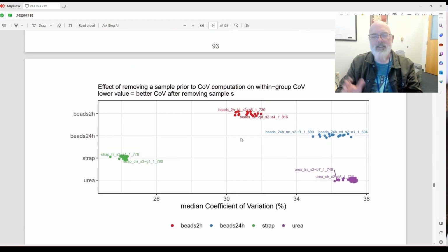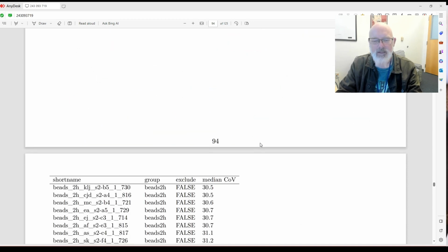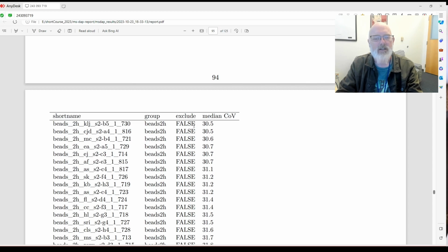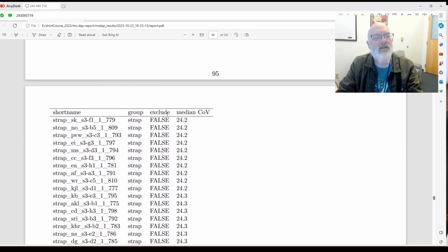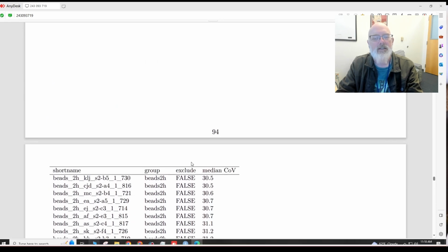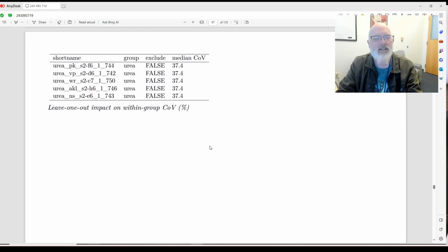And remember, when you're doing quantitation, it's not only the number of peptides or proteins you're identifying, but it's the coefficient of variation, or your ability to quantify things reproducibly. Okay. Oh, here it is. Okay, excludes. So here we go. False, false, false, false, false, false, false. Is there a true? Did they not remove any? Maybe this is where we put it in the exclude in the metadata? Maybe. Yeah, so maybe if we set these as true, it would exclude them. We'll have to rerun it and see.